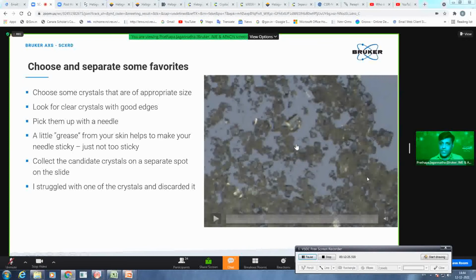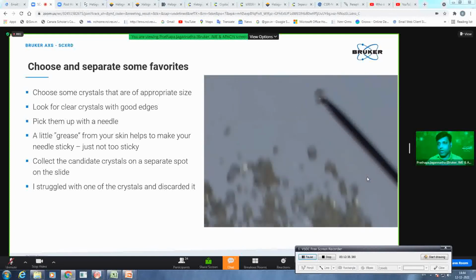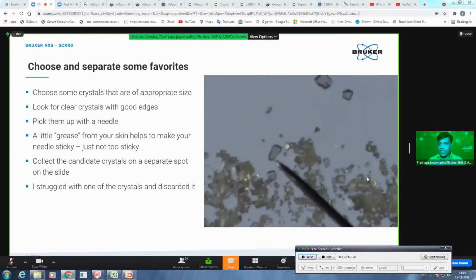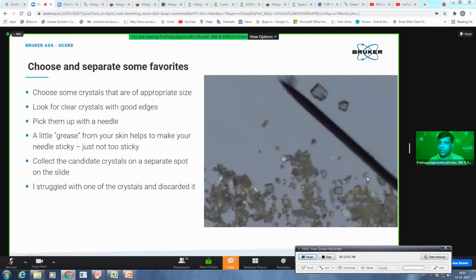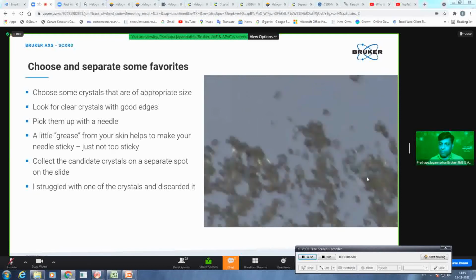We take a fresh glass slide, put some crystals on the glass slide first, and try to pick up the right candidates for our measurements. He is fortunate, he got plenty of crystals, so he is choosing out of thousands. If you have only 3 or 4, you want to pick the best one, which does not have cracks or anything, and according to the size of the beam, you want to take the crystal. If it is big, it's okay, you can always cut it, but he is initially trying to pick crystals with a particular shape and a particular size, and keeping them aside as the first attempt.